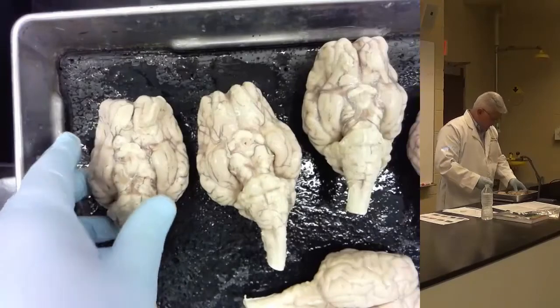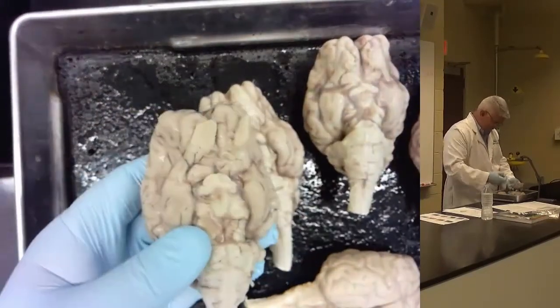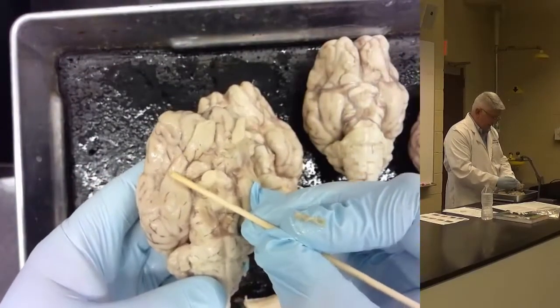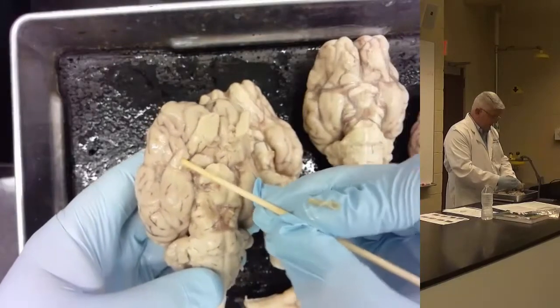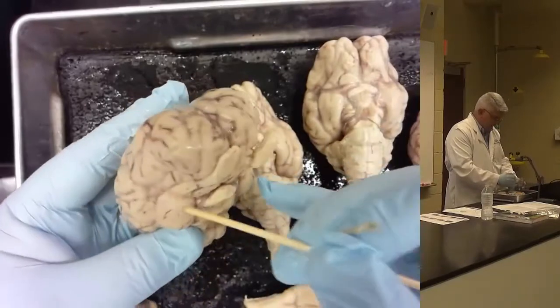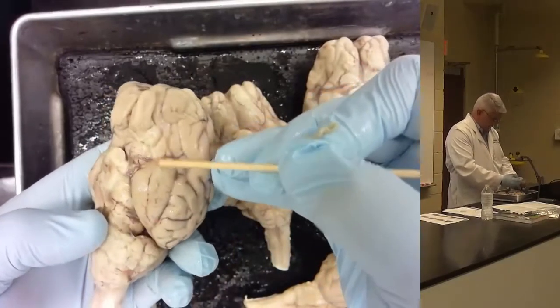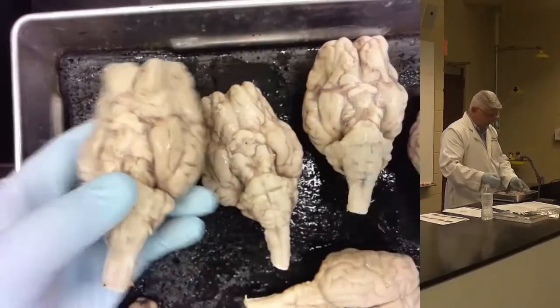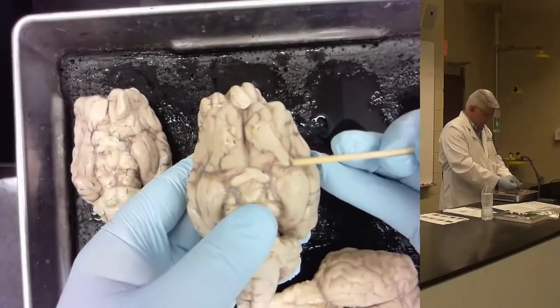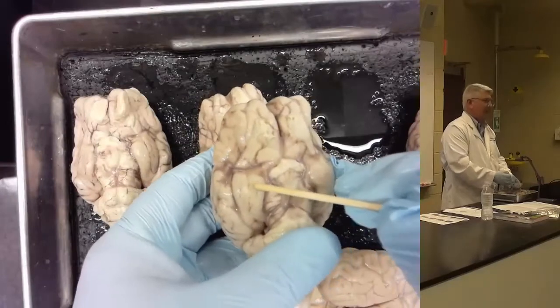Okay. Now, from the olfactory bulb, there is this smooth tract. It's a nerve tract. It's the olfactory tract that runs in and goes under the hippocampal gyrus. On this one, it kind of looks like they run together, but it's actually going under the hippocampal gyrus. Over here, goes under the hippocampal gyrus. Some of these are more pronounced than others. This is a nice one. Nice olfactory tract goes under the hippocampus.